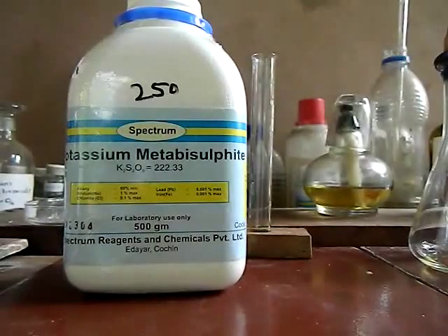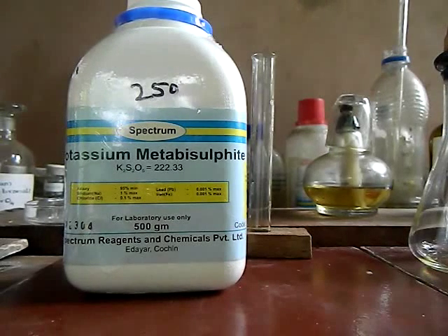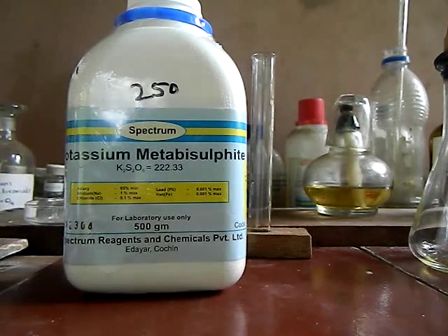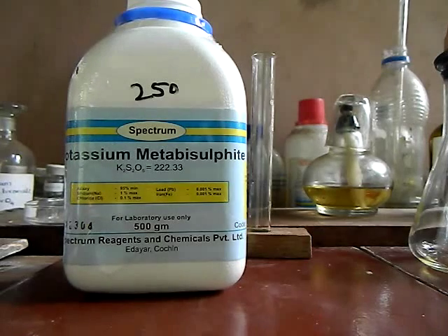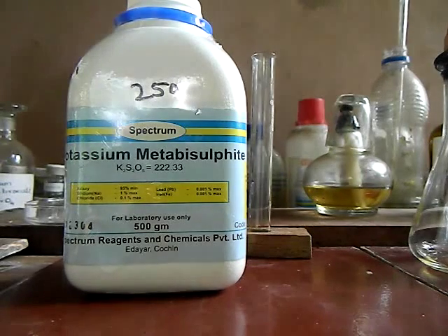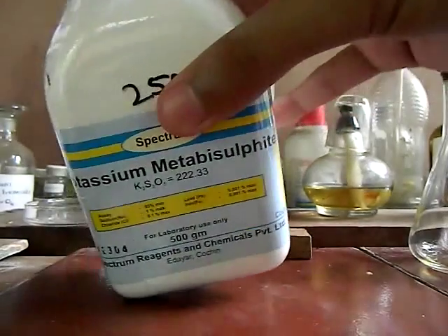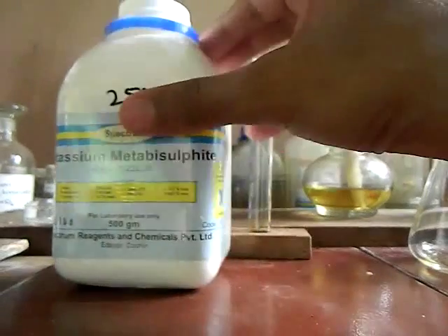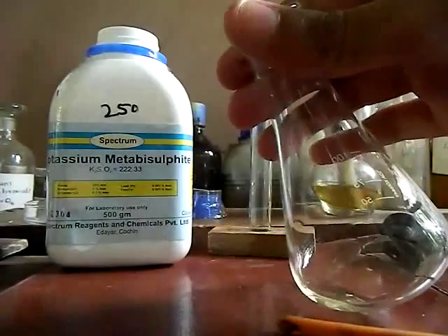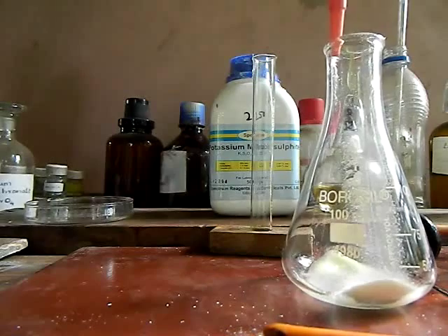Sulfur dioxide gas is conveniently prepared by adding acid to metabisulphite salt or sulfite salt. Here I am using potassium metabisulphite salt, which is taken in this conical flask. Now I add some water.